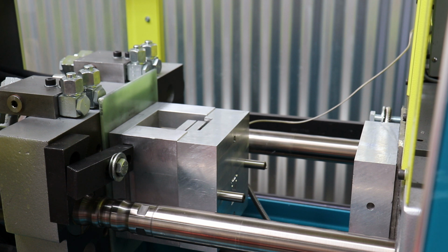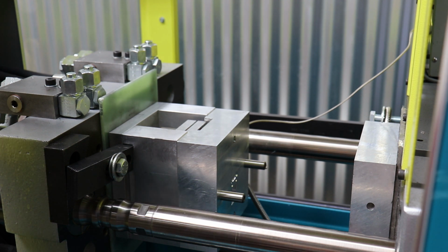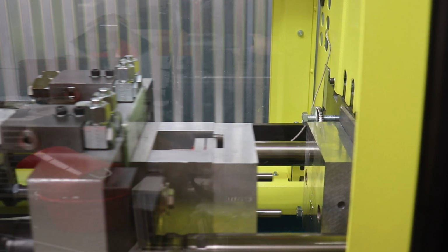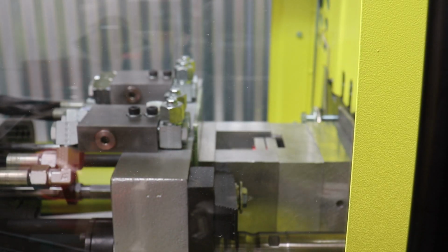I gotta turn everything back on since I hit the emergency stop button. And in general, the emergency stop button is your friend, so you should not resist hitting it. It should be normal practice for you to hit the emergency stop. So when you really need to hit it, you're gonna hit it instead of trying to figure out what to do. All right, we will do another shot. Let's see what happens. We're in semi-automatic mode.